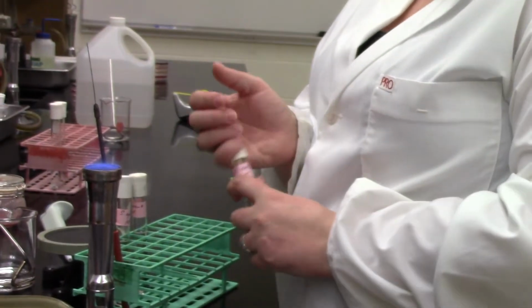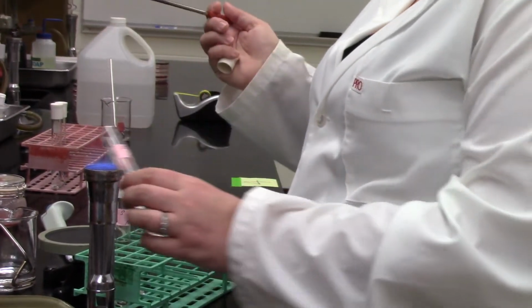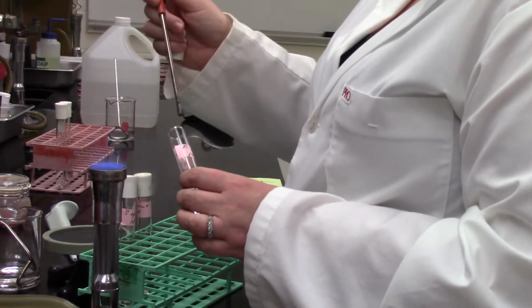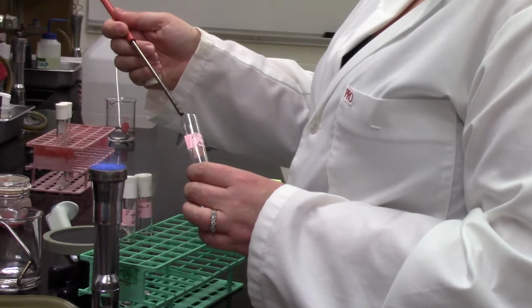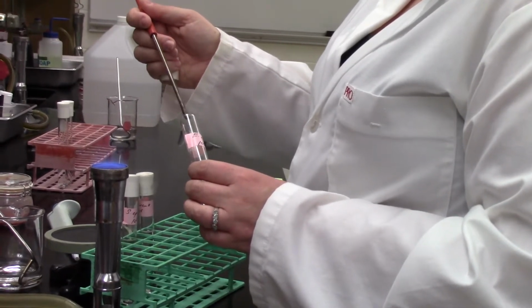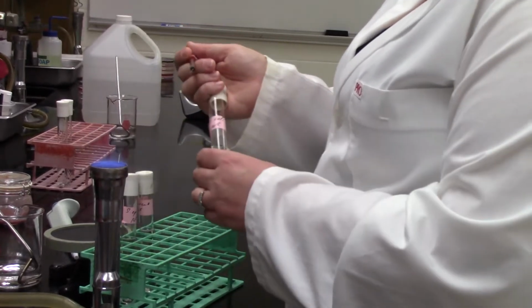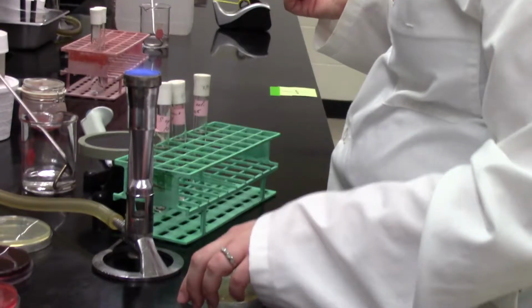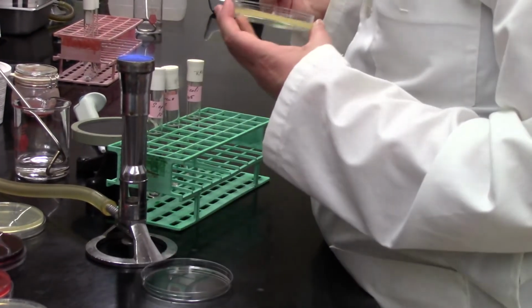And last but not least, we're going to do our E. coli sample on our tryptic soy agar, so our supportive media that should grow pretty much many types of bacteria. Definitely E. coli, as you've seen from previous labs. Tryptic soy agar is a bit of a workhorse of the microbiology lab in that it's used for growing many types of bacteria.